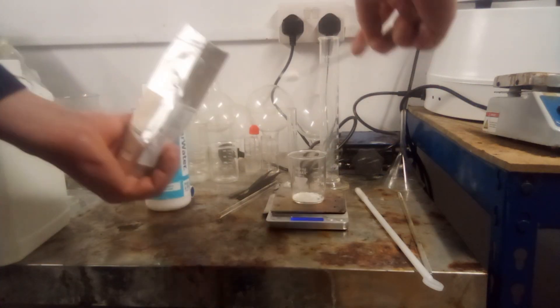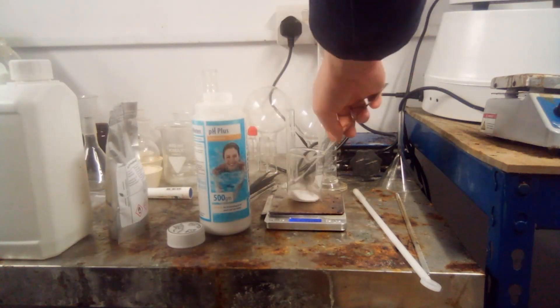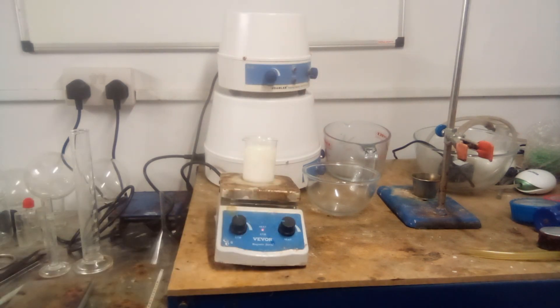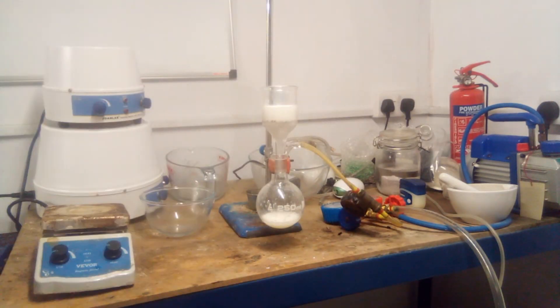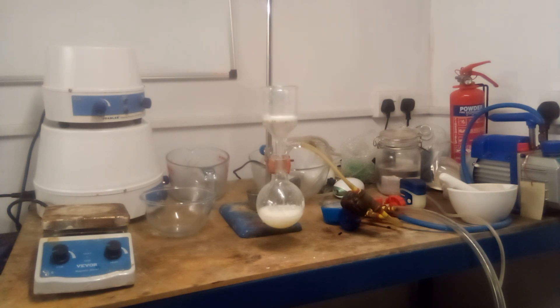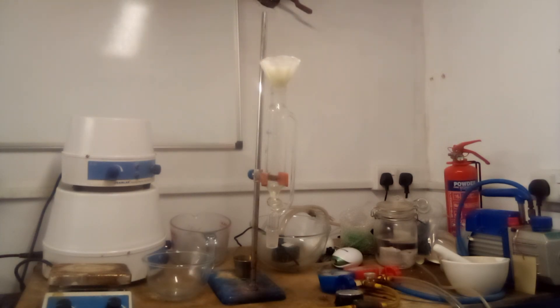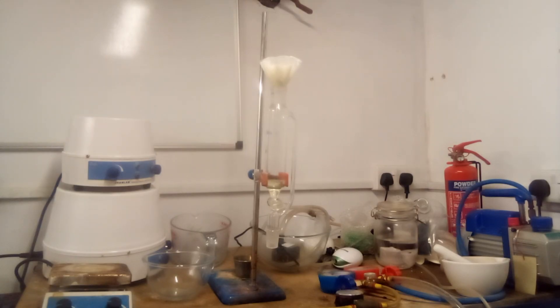Calcium hypochlorite was dissolved in 48 ml water in one beaker, and in another, 5.3 g of sodium carbonate was dissolved in 35 ml water. The carbonate solution was added to the hypochlorite solution, resulting in calcium carbonate precipitating out. The supernatant fluid — a sodium hypochlorite solution with a strength around 10% — was recovered by vacuum filtration and filtered again by gravity into an addition funnel to remove fine particles. Calcium hypochlorite is also available in hardware shops as a disinfectant for swimming pools, but the smallest pack size is about 10 kg, which is pretty useless at this scale.